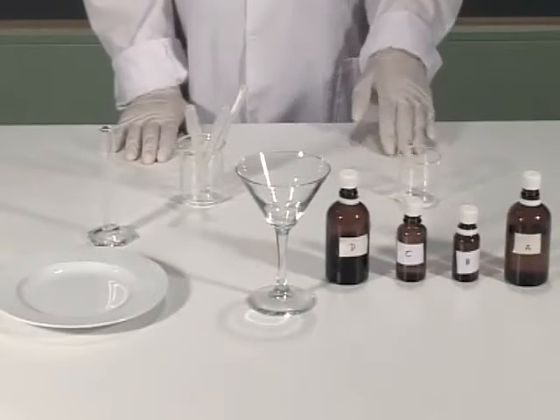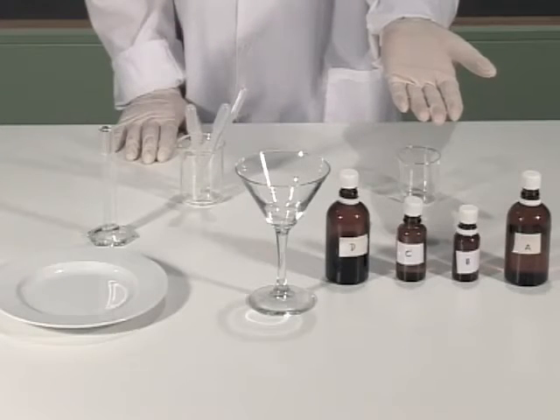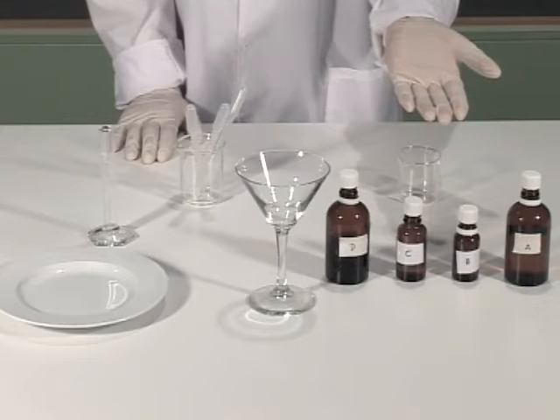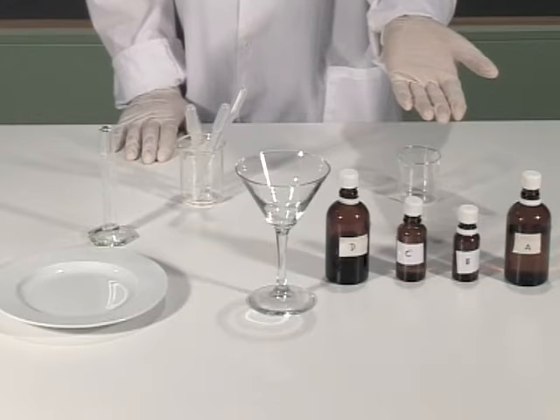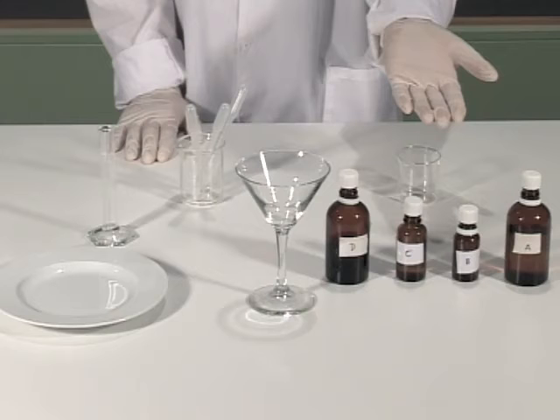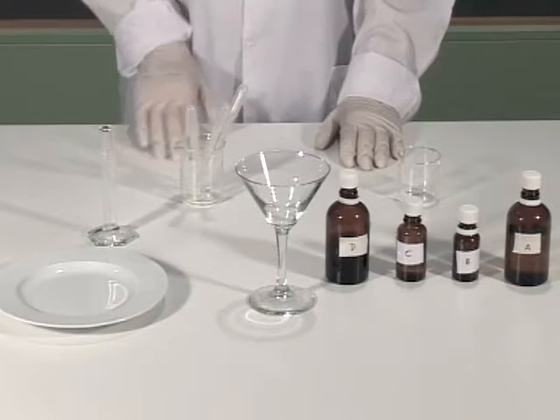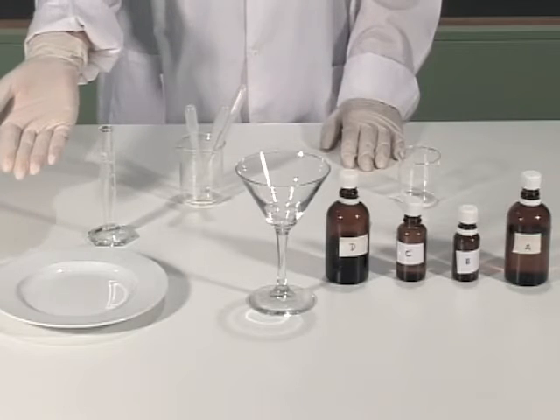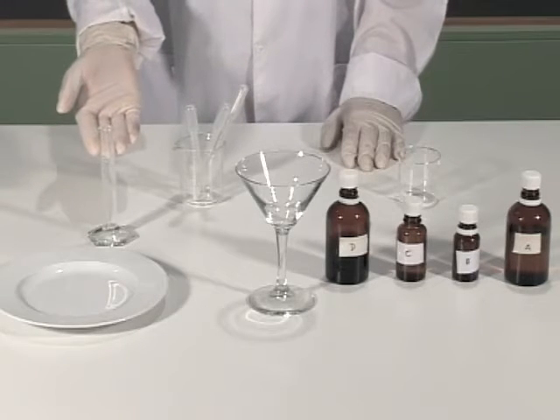We will need solution A, which contains sulphuric acid and potassium bromate; solution B, which contains potassium bromide; solution C, which contains malonic acid; solution D, which contains phenanthroline and ferrous sulphate heptahydrate; a glass, plate, volumetric tube and drop glasses.